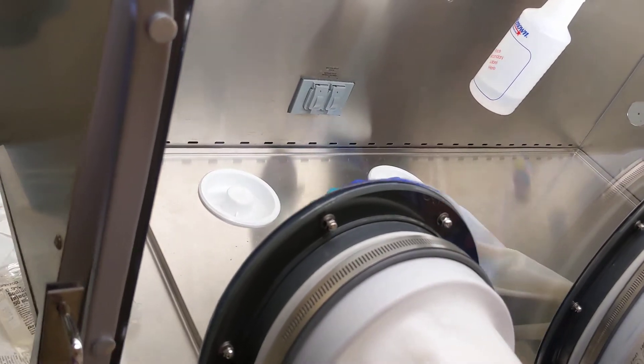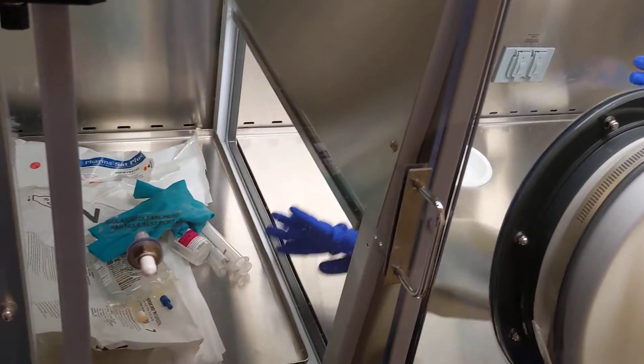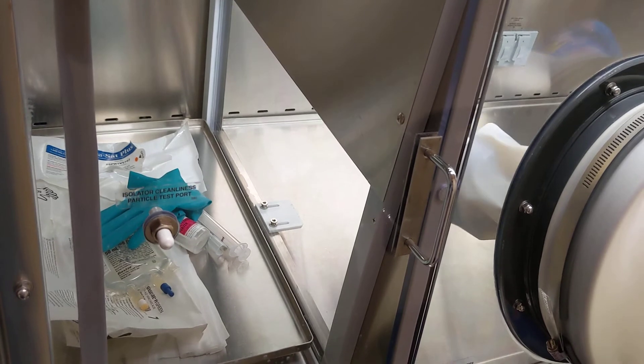The sterile gloves come off, and then this gets closed because you never want to have both these doors open at the same time.